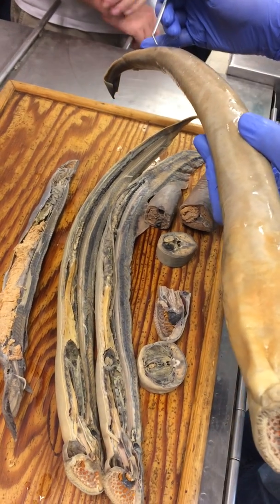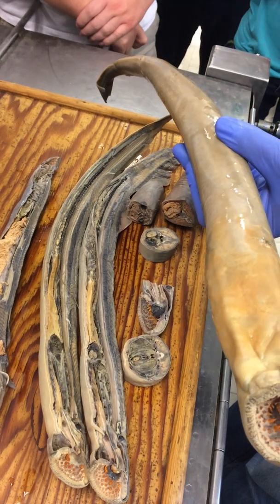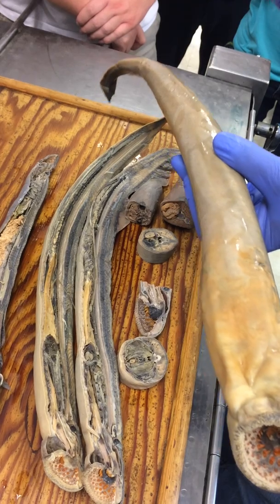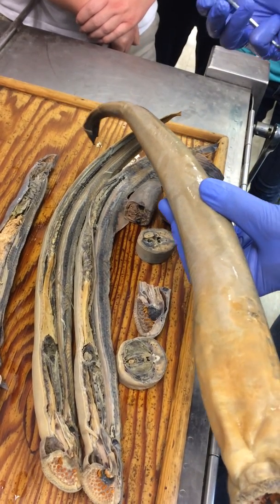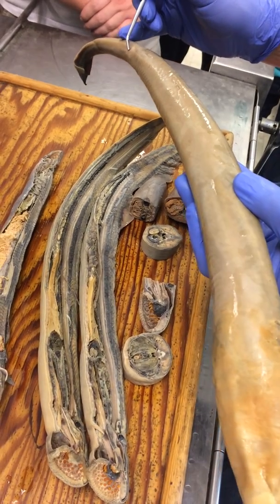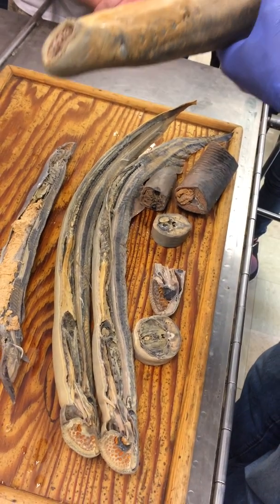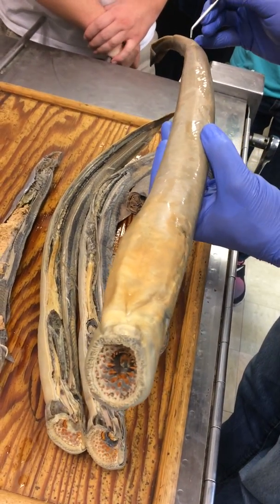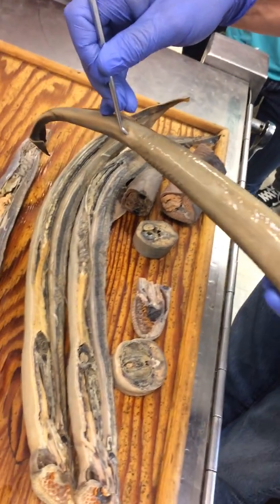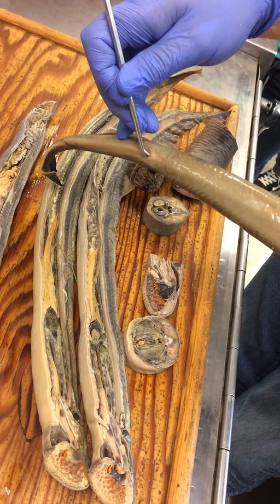This opening of the urogenital tract and digestive tract is called the cloacal aperture. The cavity that's opening to the surface is the cloaca. In Latin, cloaca means sewer because it's where everything dumps. And the little papilla that sticks out there would be the urogenital papilla — that's where urine and eggs and sperm come out. And then anterior to that, cranial to that, is the opening of the anus or the intestine into the cloaca.